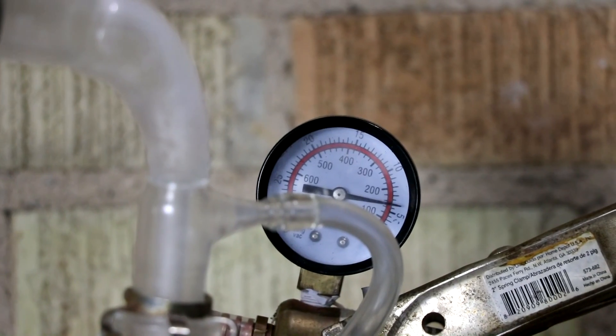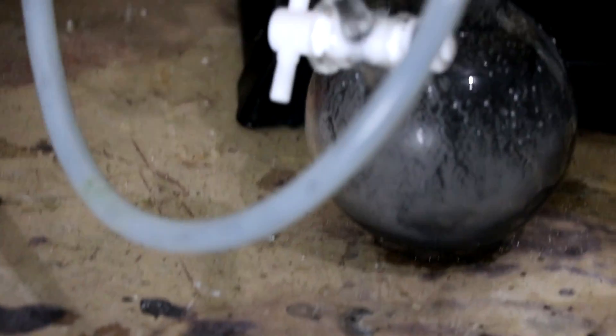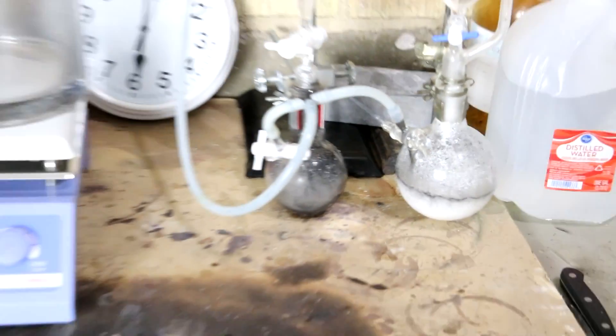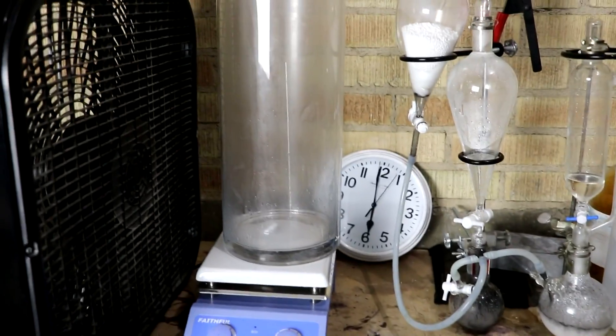Looks like I've overshot my target pressure a little bit. And the reaction's continuing, but that's alright. A little bit excess on the SO2.